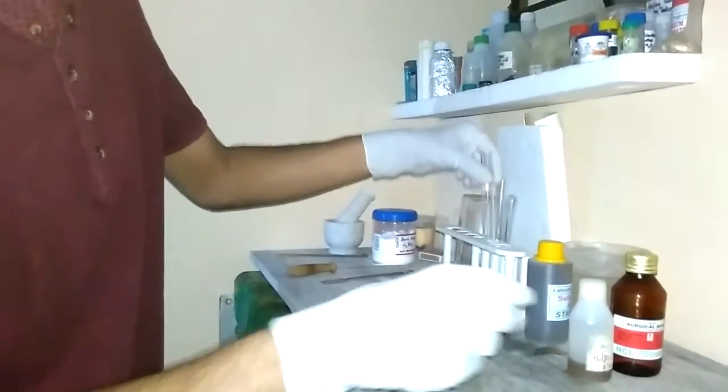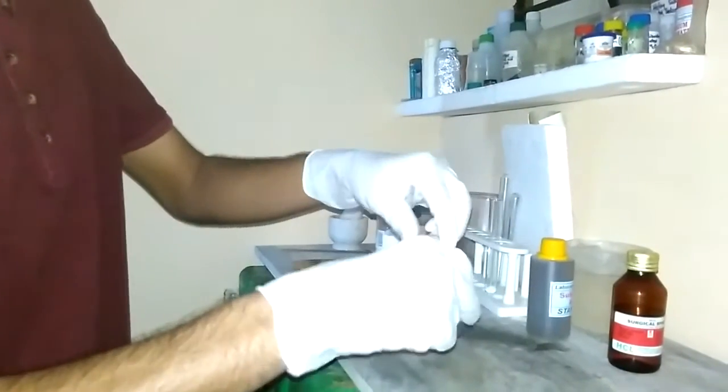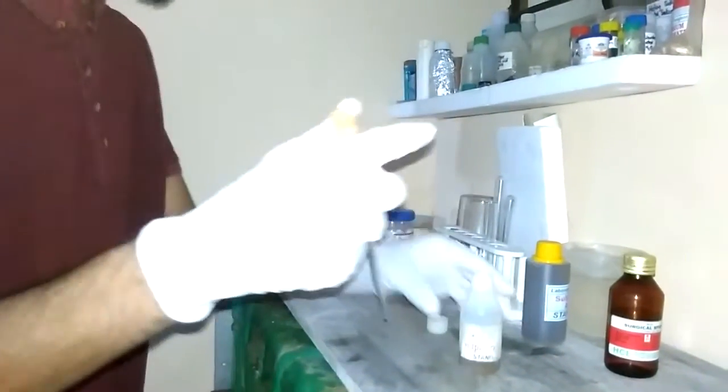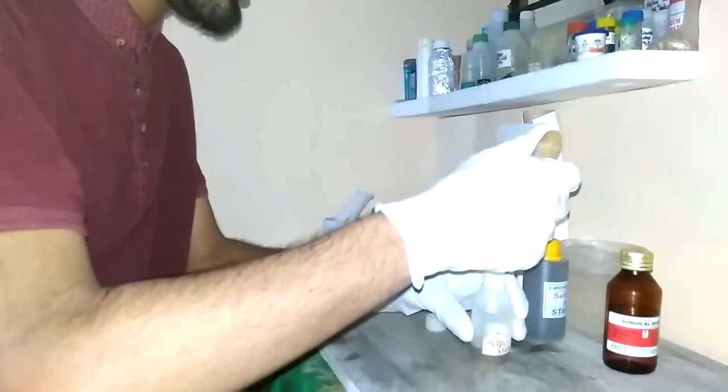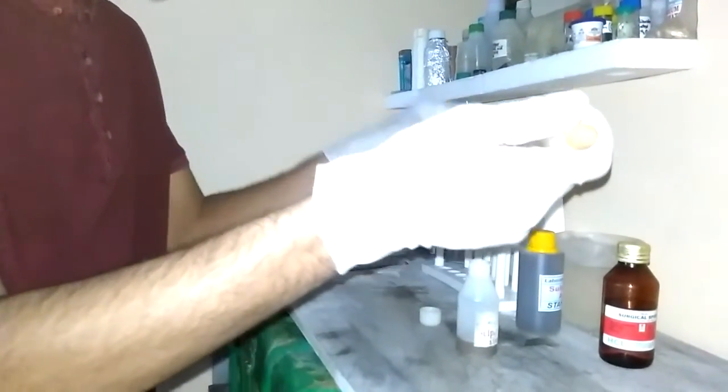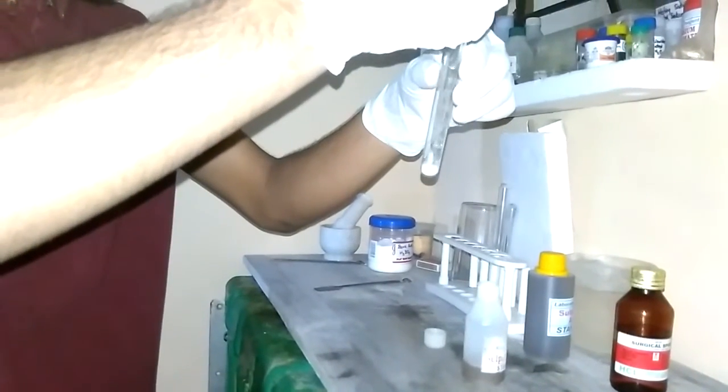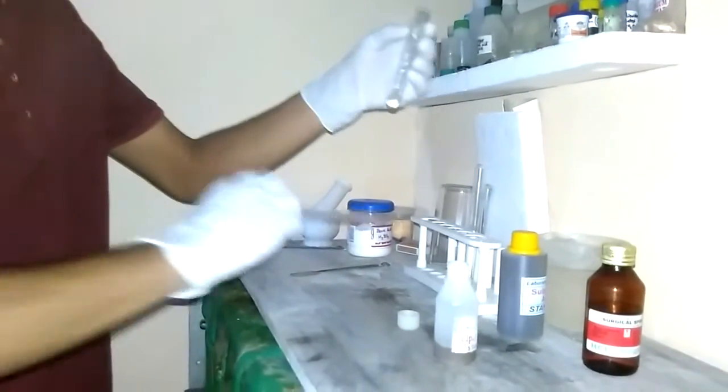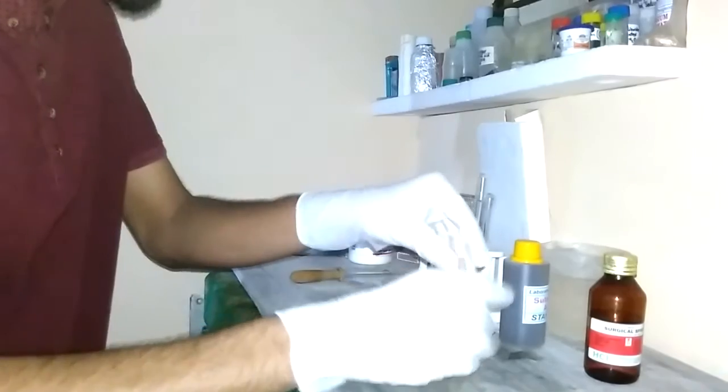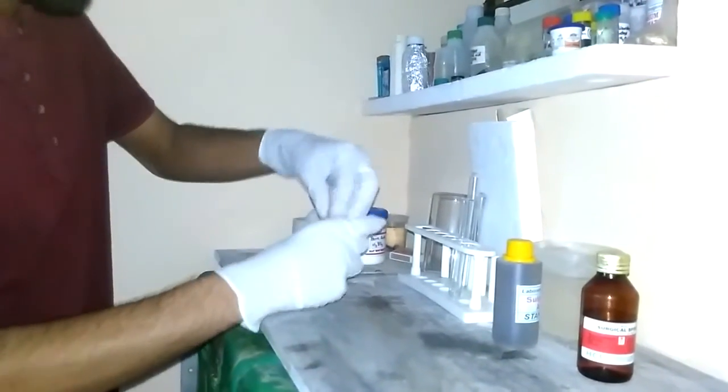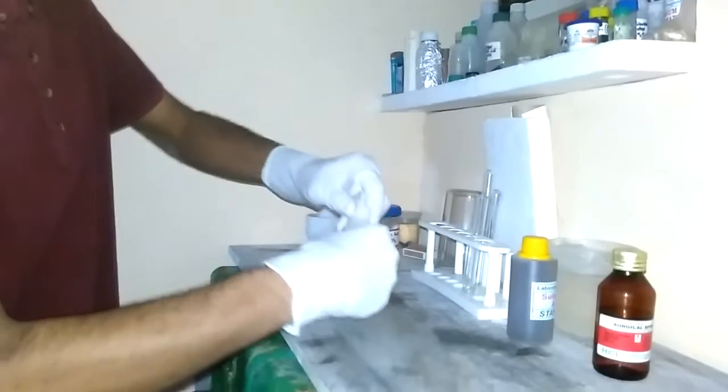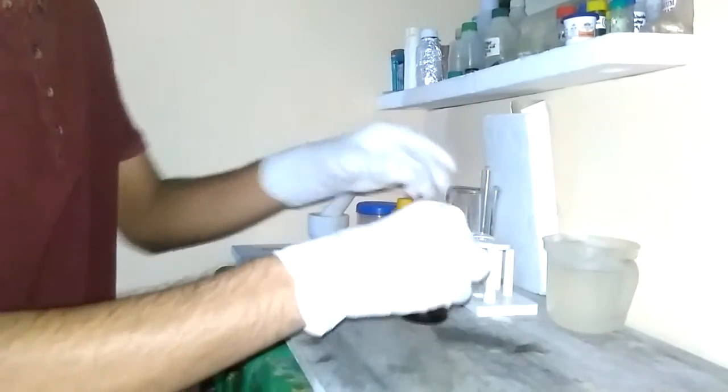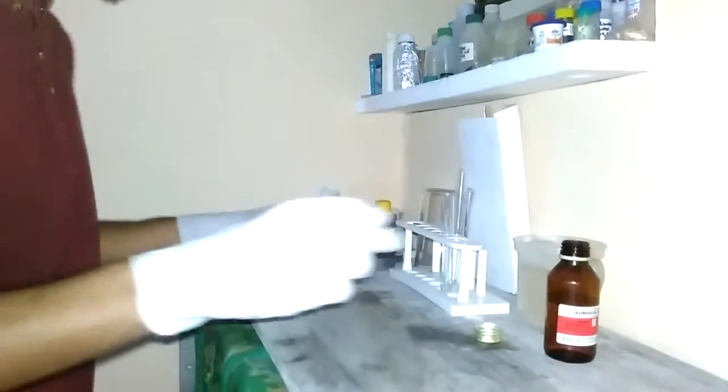This is the boric acid which we have taken. I will be adding some sulfuric acid to it so that the heat produced might increase the rate of reaction. Please be careful while handling concentrated sulfuric acid because it's very caustic and might cause skin burns.